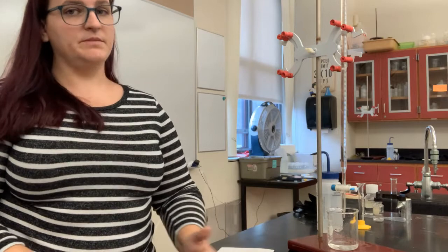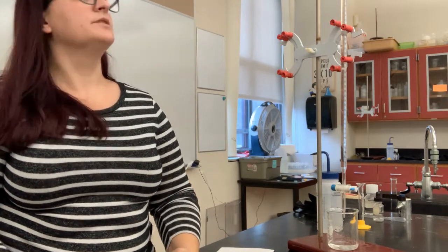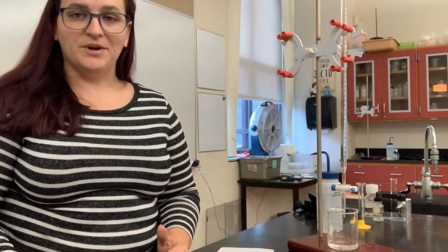and now I'm ready to go. I would want to write down my initial burette reading. It's not quite at 0, but that's perfectly fine. Mine's somewhere between 0 and 1-ish. It doesn't matter as long as you record exactly what it is.